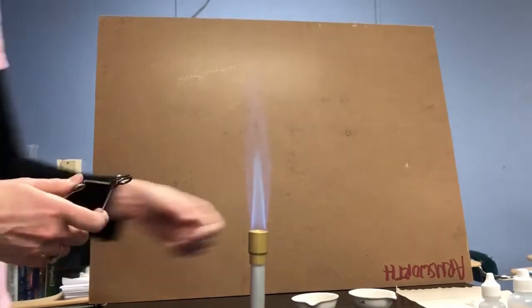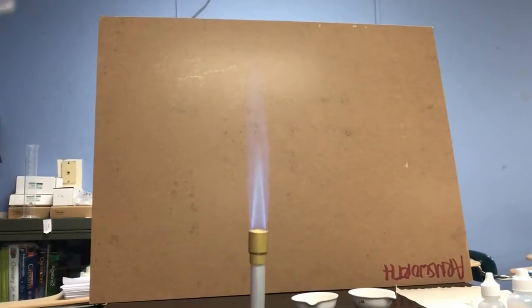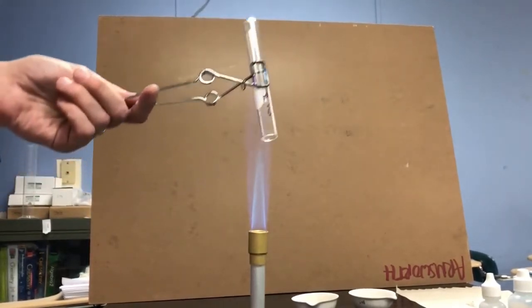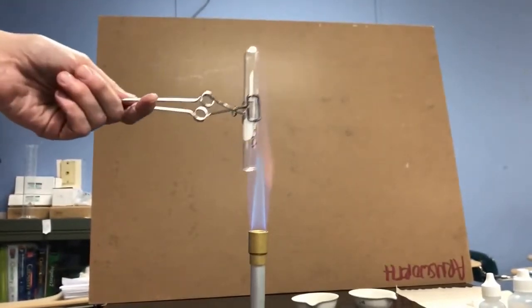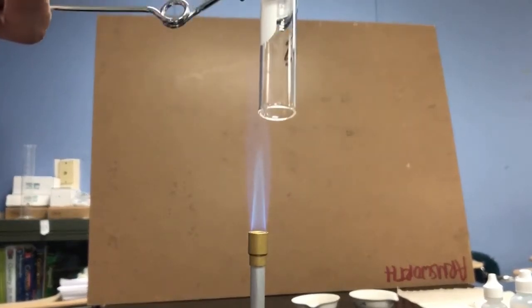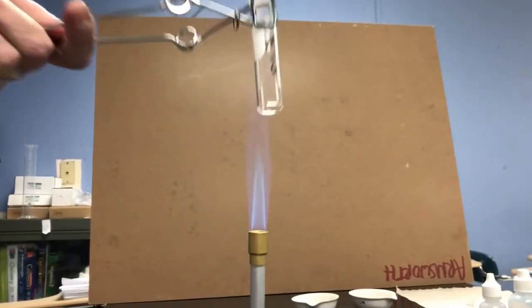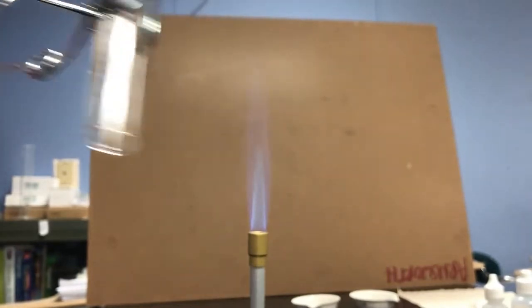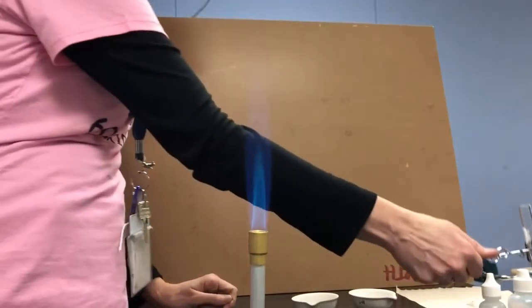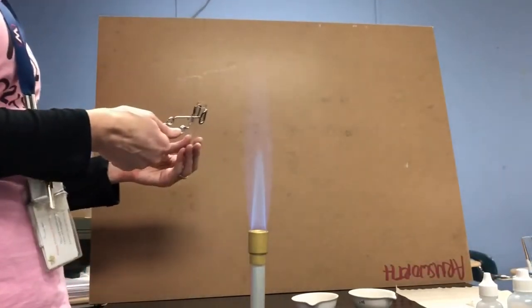And what I'm going to do is take a clean, dry test tube that's kind of at room temperature. This first observation I want you to make happens quite quickly. One more time. Okay, I think the test tube is actually getting too hot to be able to make that observation anymore. I'm going to switch to another cool test tube. I hope you see that the test tube actually gets foggy. There's kind of a fogginess going on inside the test tube.